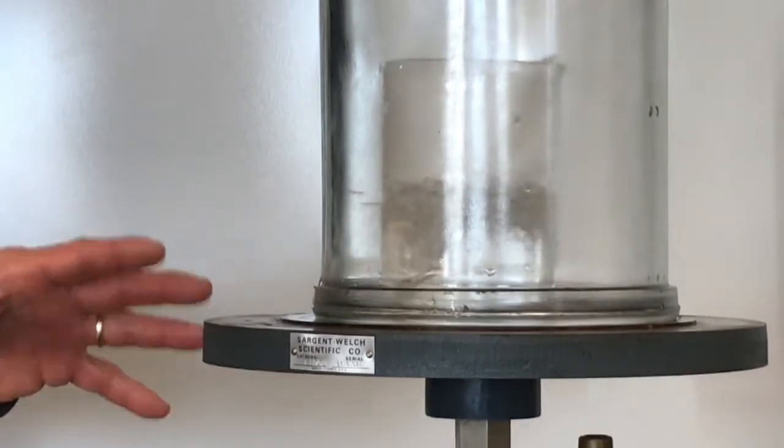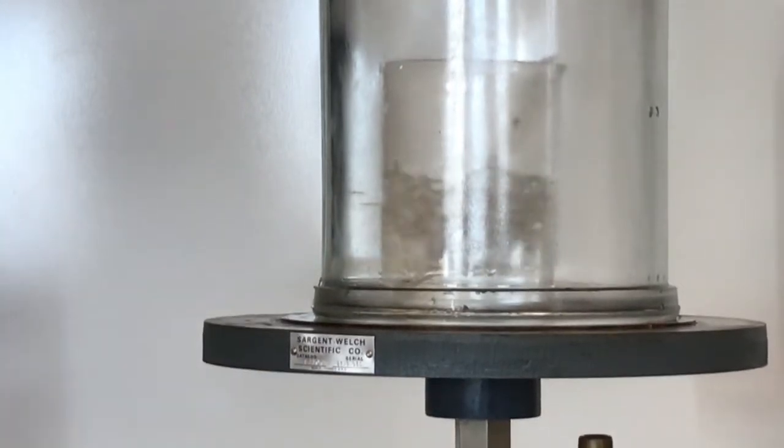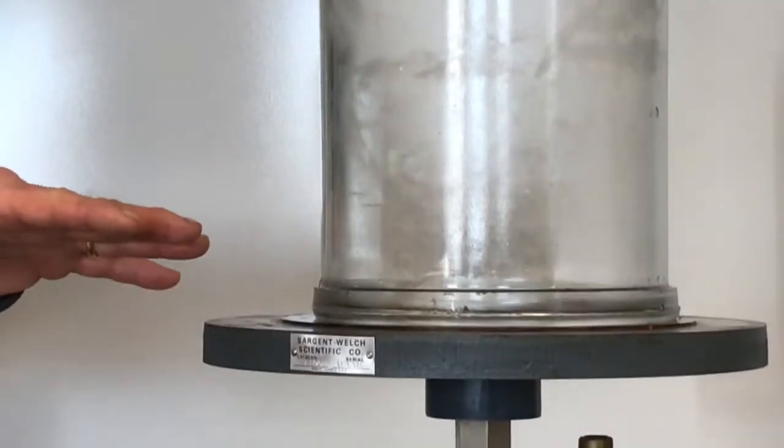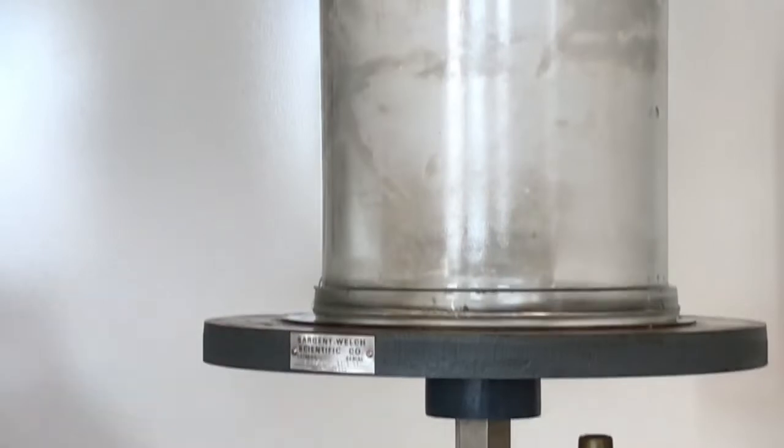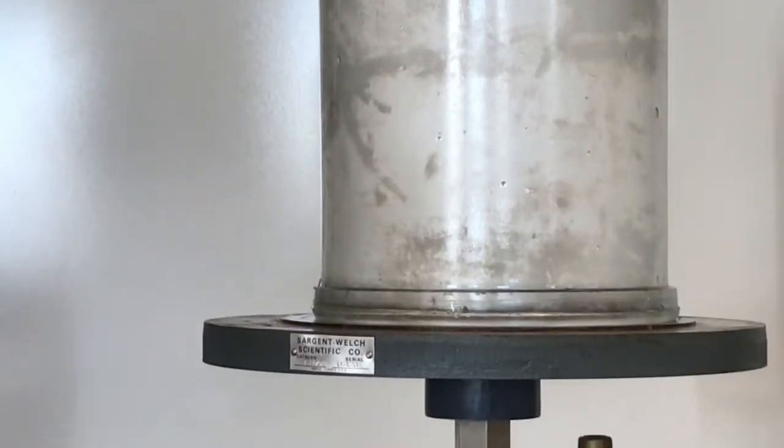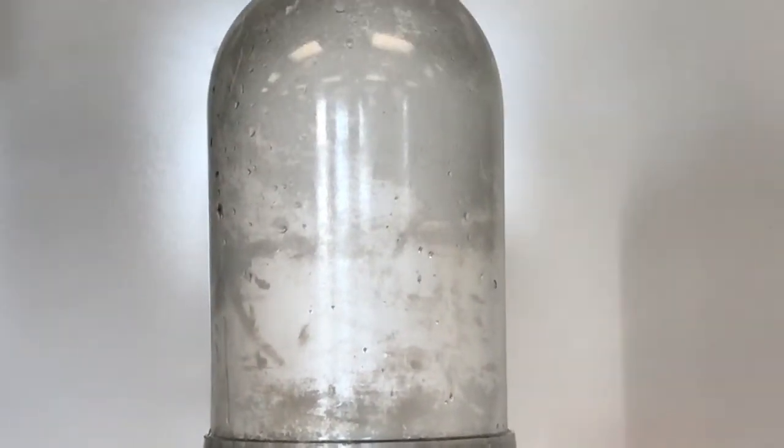So right now the water is boiling like crazy. Simply because we have lowered the pressure inside. Now you're not going to be able to see it in a minute because there's going to be so much evaporation. There will be a lot of water vapor in there. The water is just boiling away like crazy.